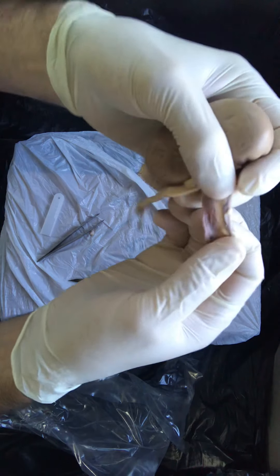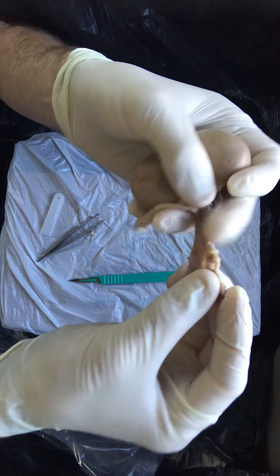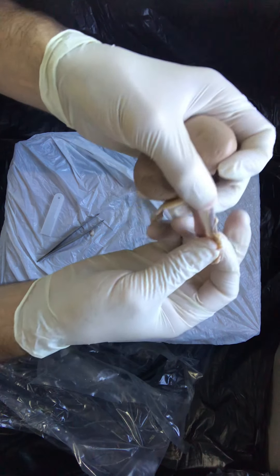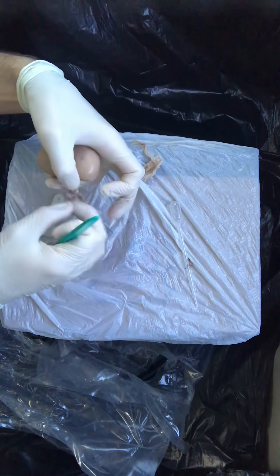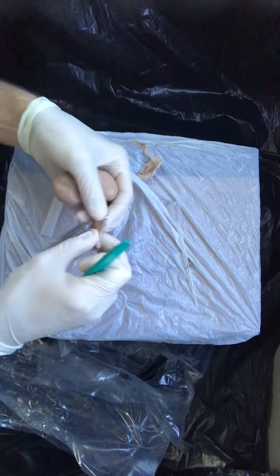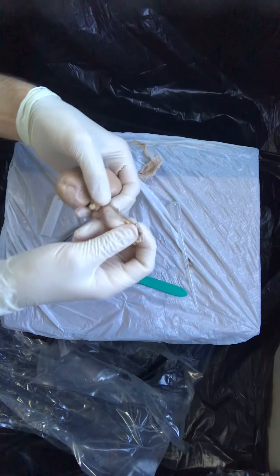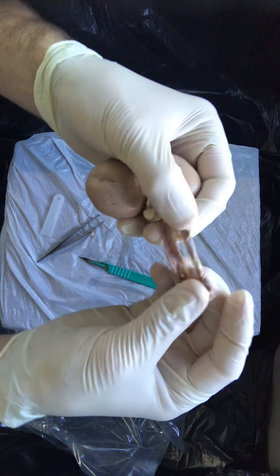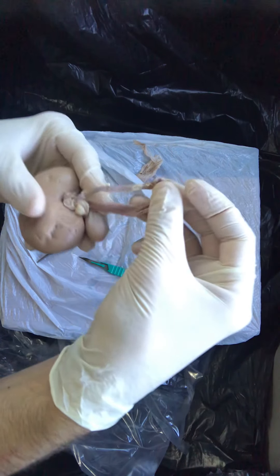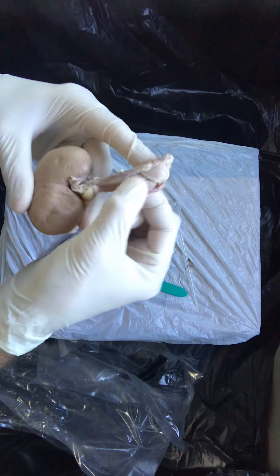Even as you hold these vascular structures in your hands, you might notice that you can actually start to see a window between two hollow structures. There are really two things here that are held together by some connective tissue, and you can start to use your scalpel or your scissors to make a nick in that transparent tissue, and you can really start to tease apart these two structures. What you're going to see on the inferior part of your screen — the one that I'm going to pinch in my fingers — this one here is going to be the vein.